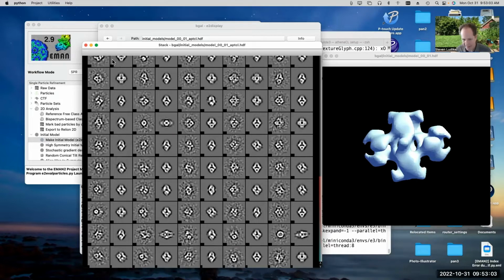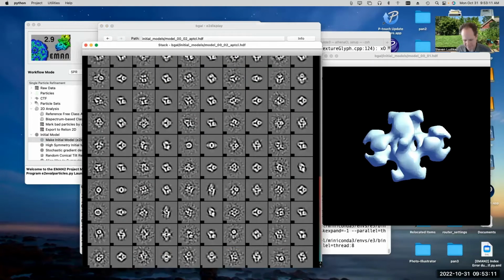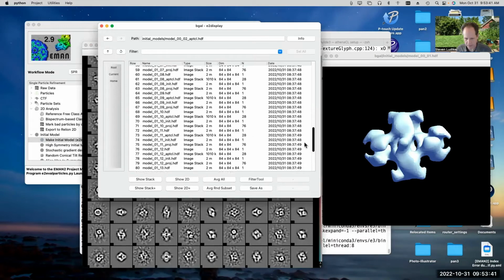Anyway, all right. So let's take a look at the second one. Maybe the second one is better than the first one in this case, and we'll see that. No, again, it just didn't come up with very good answers. Now, this may be because I only told it to do 8 trials, and it just didn't wind up with a very good initial guess. It's a stochastic kind of process, so you probably want to try 20 or 30 or something like that. The advice in the tutorial is you try running it once with 10, and if you don't get a good answer, then try it again. That can work sometimes.